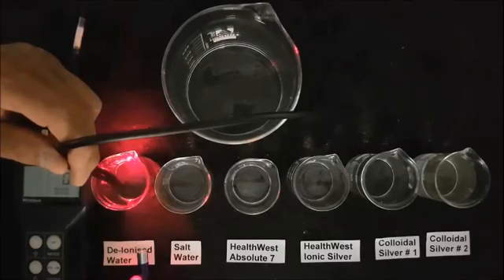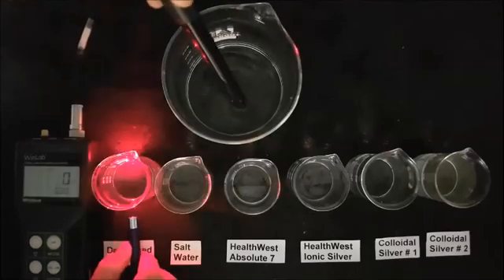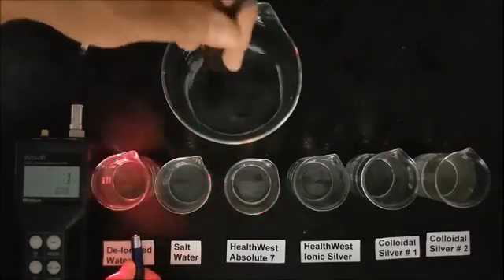As you can see this does not exhibit any Tyndall effect at all because there are no particles or colloids or metals or impurities because it is pure demineralized water.